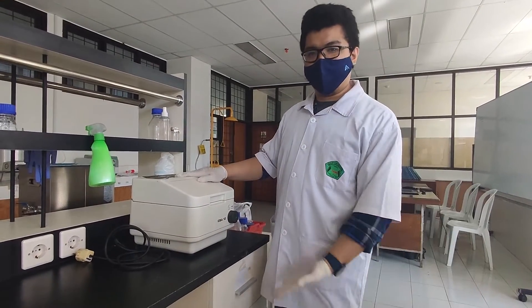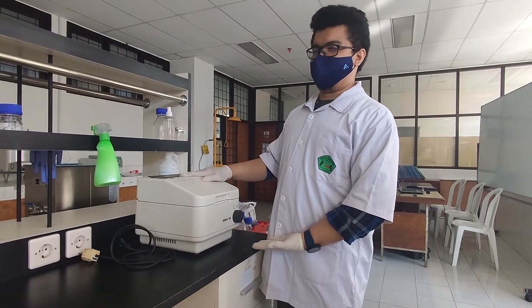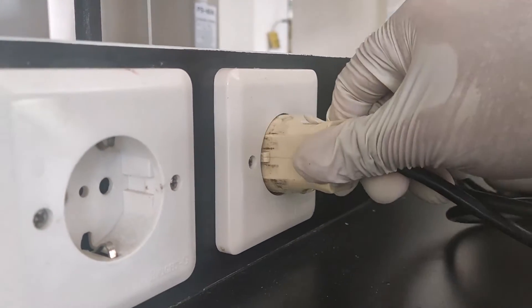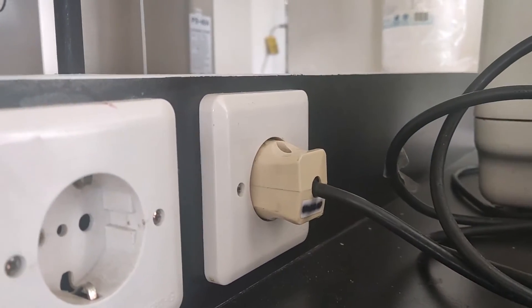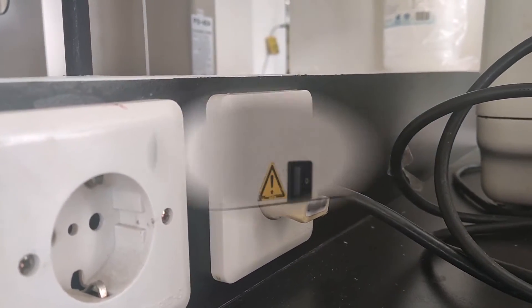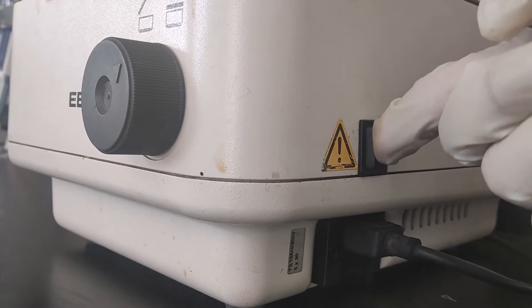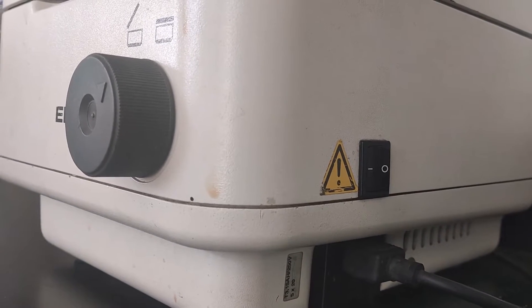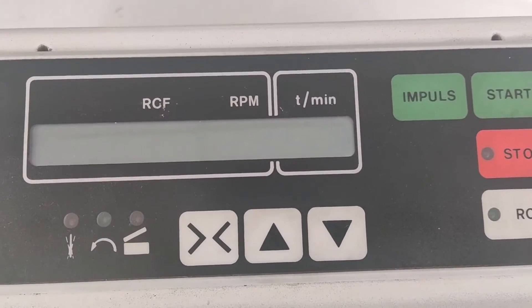Hello everyone, my name is Ricky and I will explain to you how to use a centrifuge. Here we use a Hettich centrifuge EBA-12. The first step is to plug in the power cord, and then we turn on the centrifuge itself. When it turns on, the display will look like this.